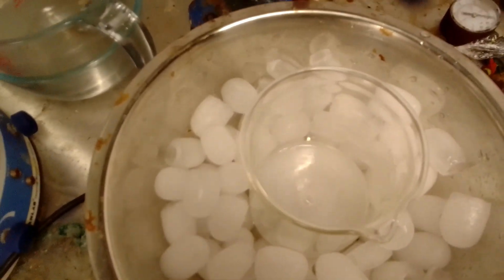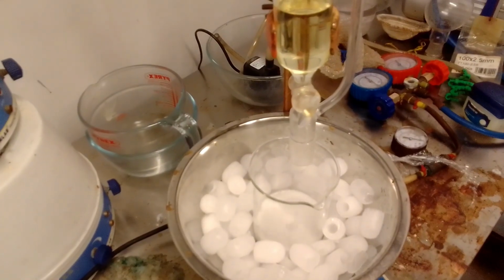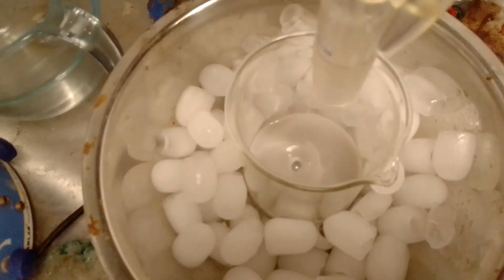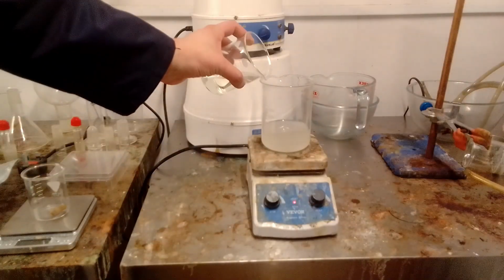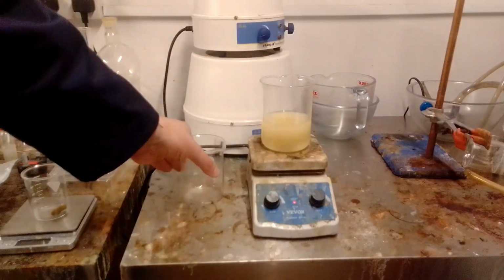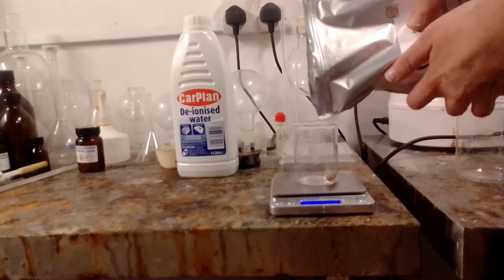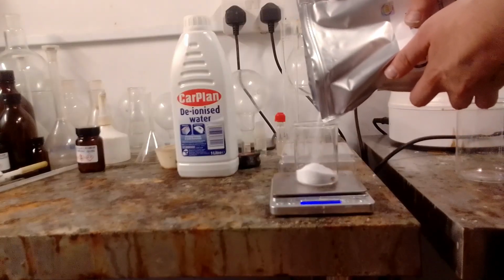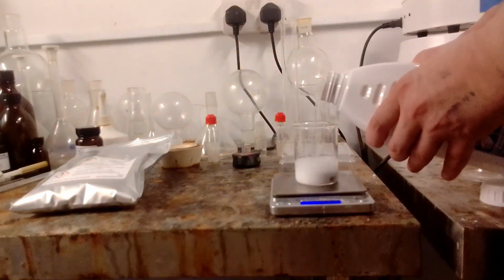When the solids in the mixture started to turn grey, indicating the formation of cadmium borohydride, the acid chloride solution was added to the mixture dropwise. During the addition, which took around an hour, sodium metabisulfite was dissolved in 66.5 grams of water, making it up to 30% weight, and potassium carbonate was dissolved in 44 grams of water, making it up to 40% weight. Making the solutions up at this point made good use of the dead time in the process.